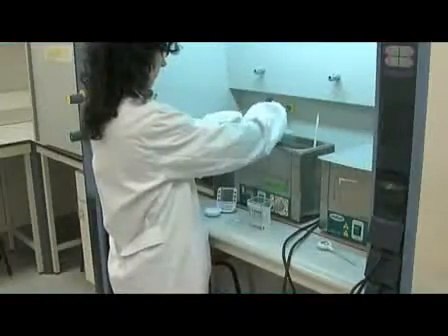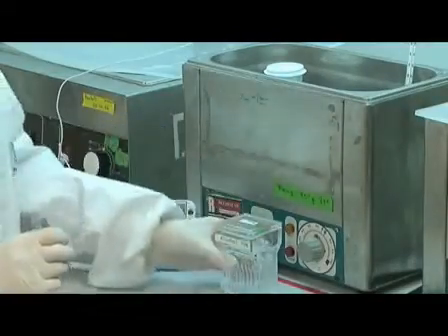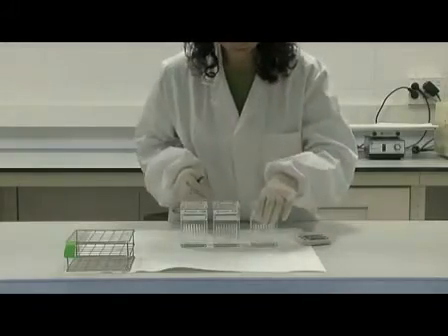To conclude the slide treatment, a final transfer in the ethanol solution is required, submerging the slides for one minute per Coplin jar.